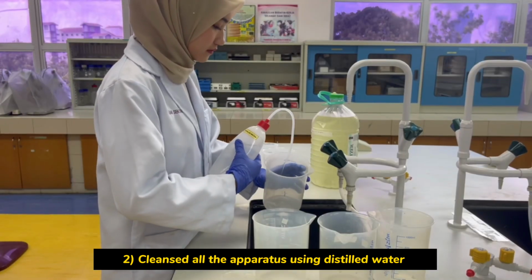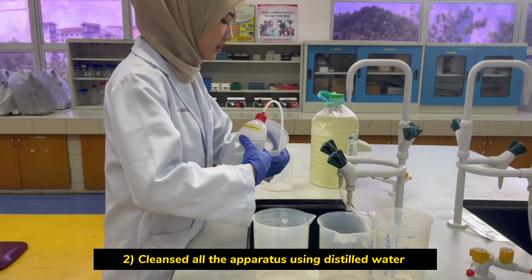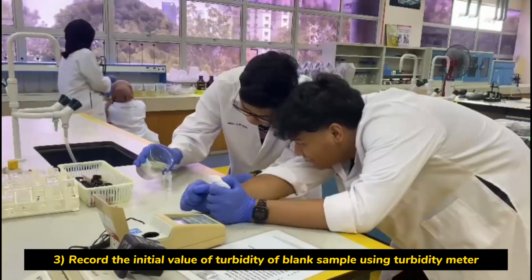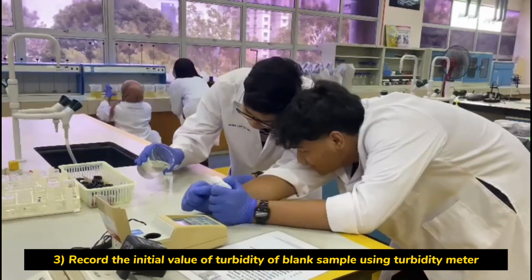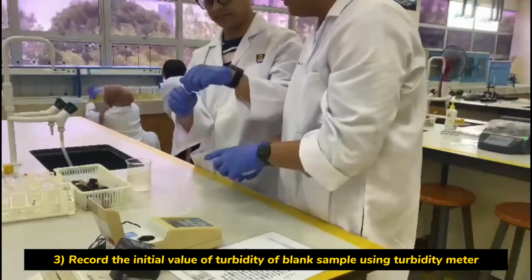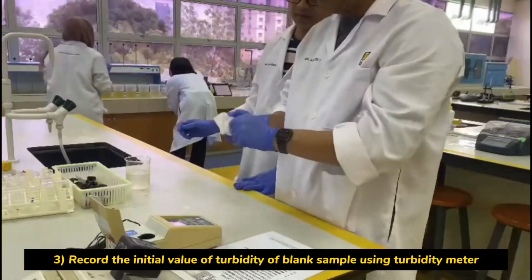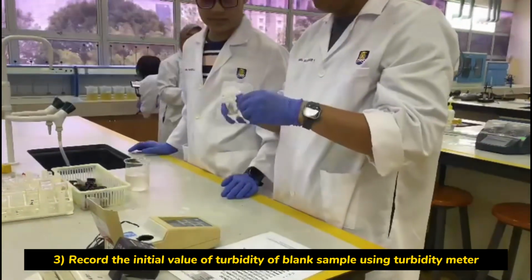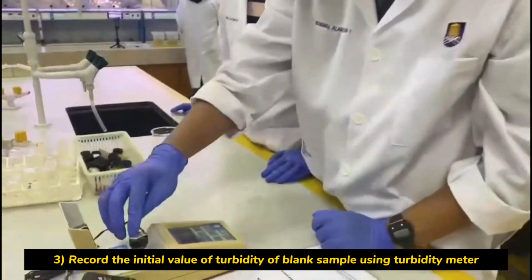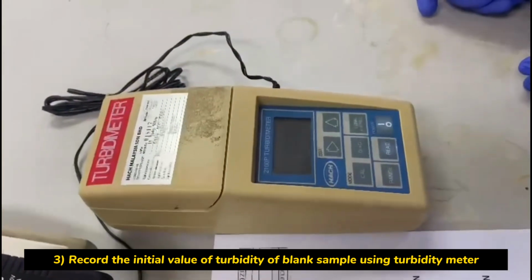Before we run the parameter test, we need to rinse the turbidity bottle and square sample cell with distilled water. For the turbidity test, first we pour the water sample into the turbidity bottle. Then we clean the turbidity bottle so it can be read at the turbidity meter. Press the read button and the data will show at the turbidity meter.